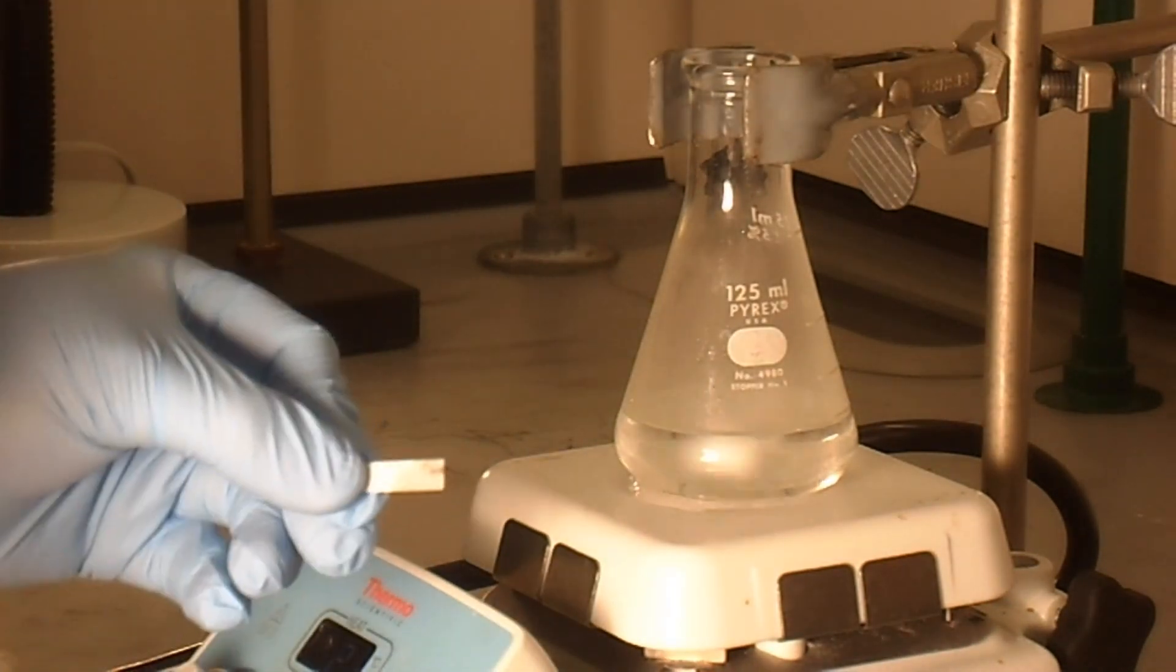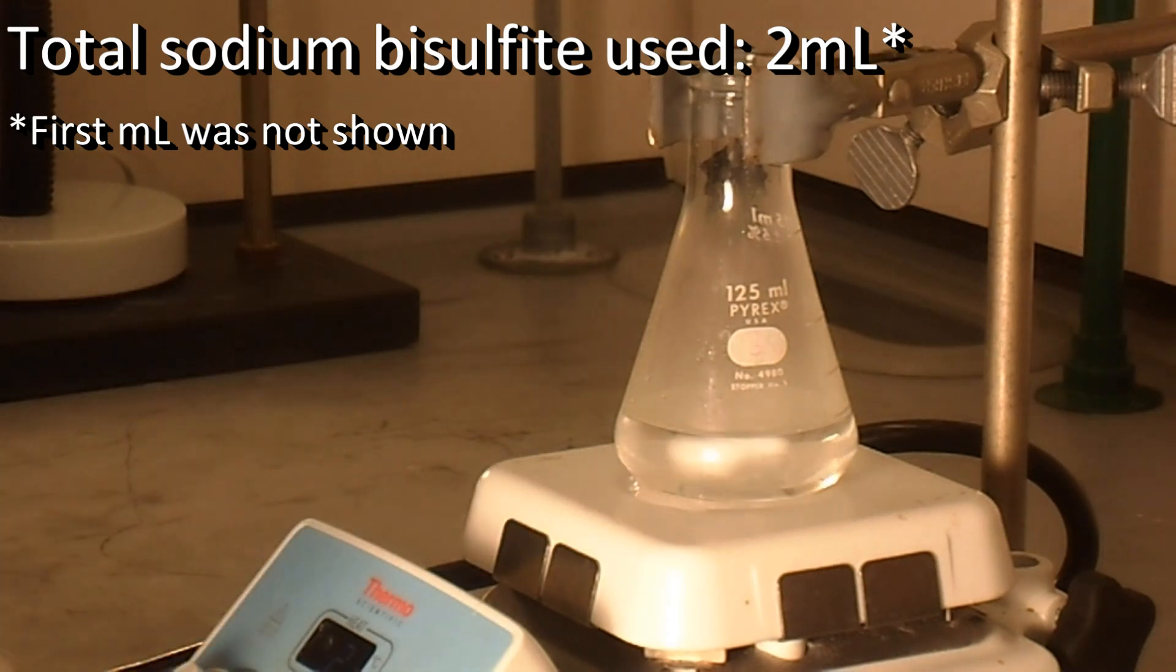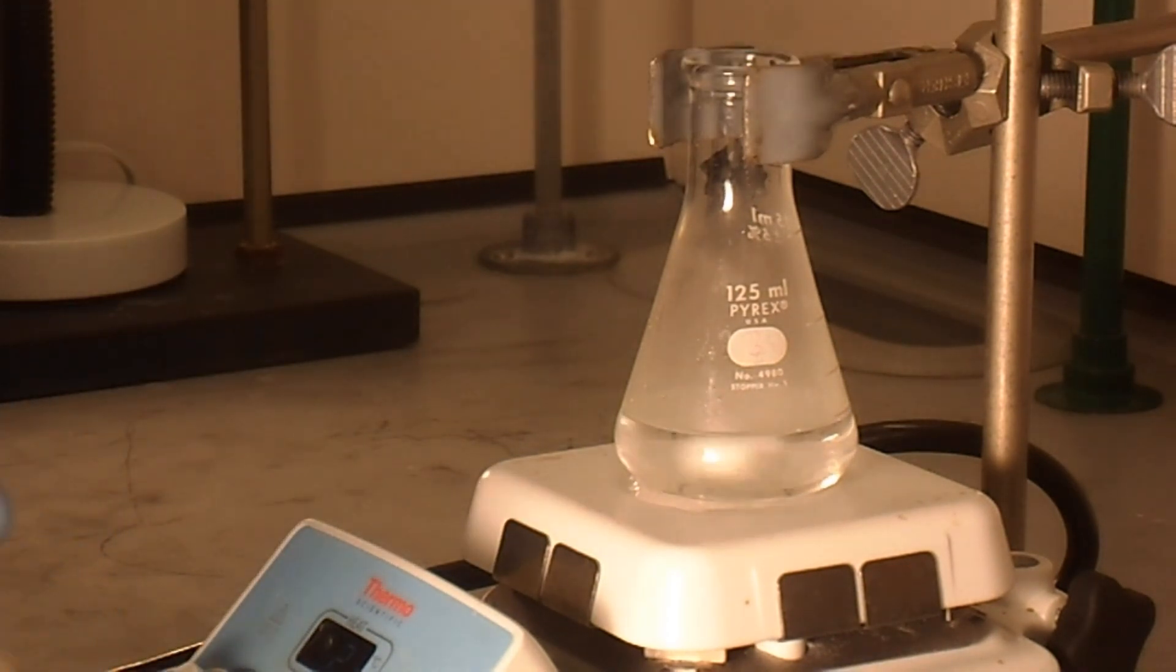So for us, that was 2 milliliters. So we've used 2 milliliters of bisulfite and we have a clear test.